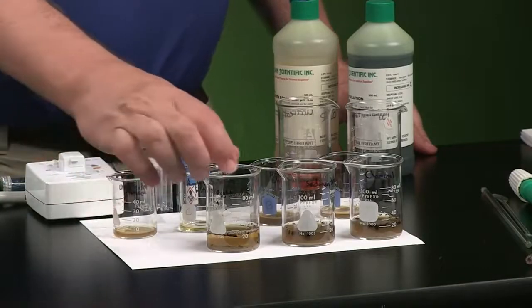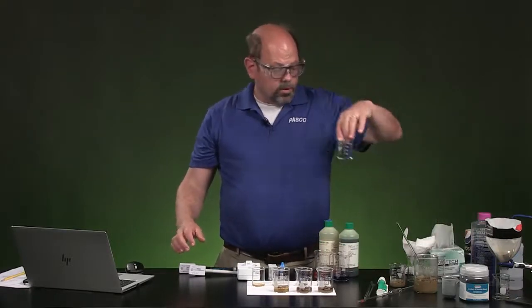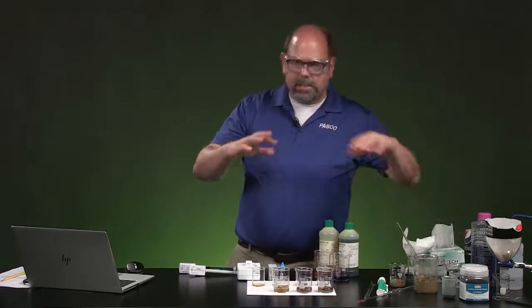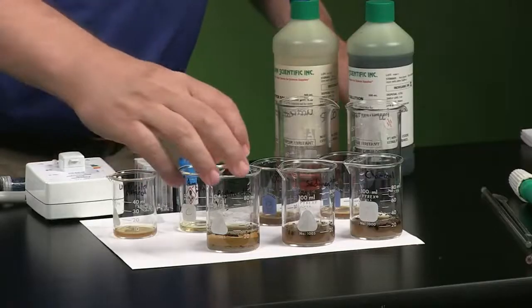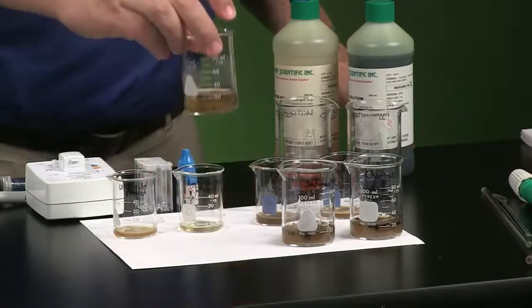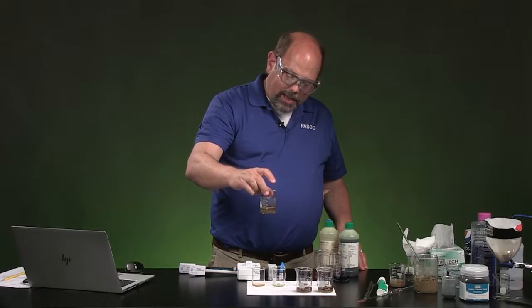The next one, here I added the pool clarifier, okay, which forms a light set of molecules that crystallize out and make sort of feathery looking things, and they settle down. As a matter of fact, if you're looking from the front camera, you can see if I shake that just a little bit, there's sort of a light clayey look. It's almost like it's got waves in it.